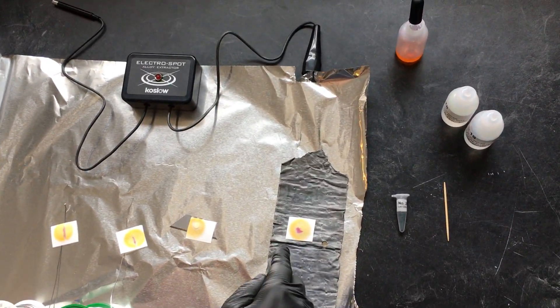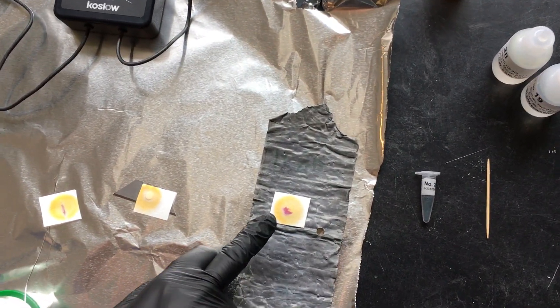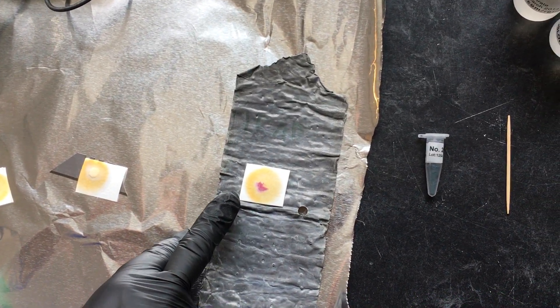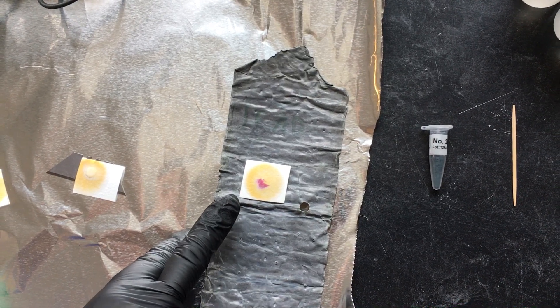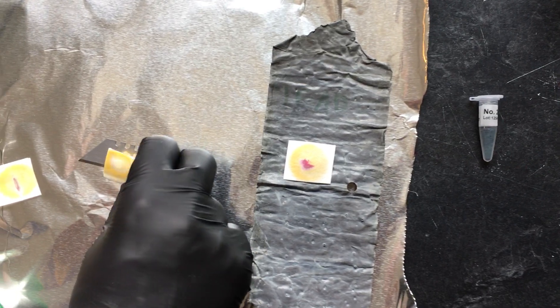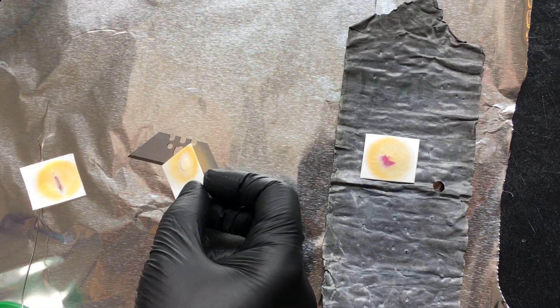Obviously, the lead sheet looks terrific. I mean, that is a rich magenta color. It's the magenta purple that we're really concentrating on. That's indicating a positive lead test. The razor blade is showing no lead at all.